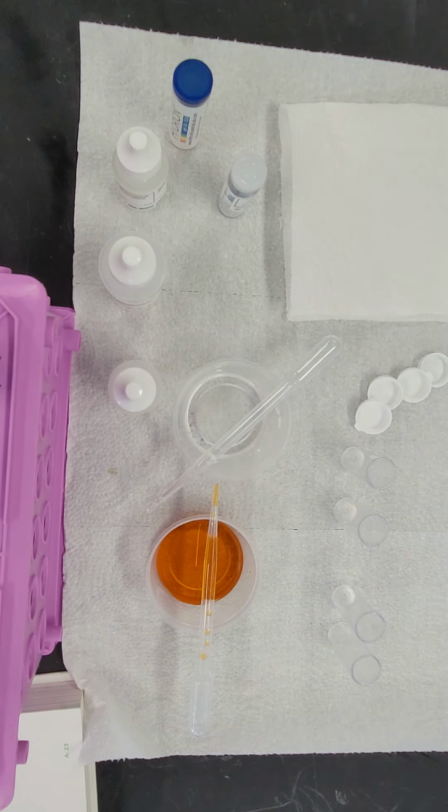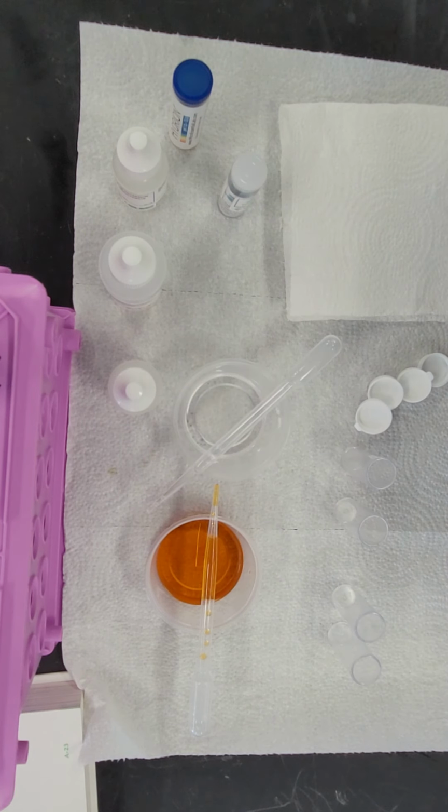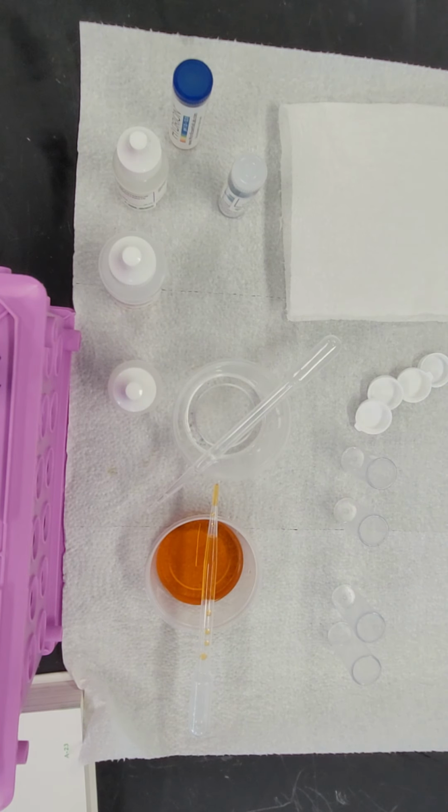In the previous activities, you observed some unidentified substances in a large container, and in an effort to identify those substances, you made some observations about physical characteristics such as density and appearance. Once you made those observations, you separated the solids out into one container, cleaned, and then separated the two liquid substances into two separate containers. Now you may notice that my substances look a little bit different.